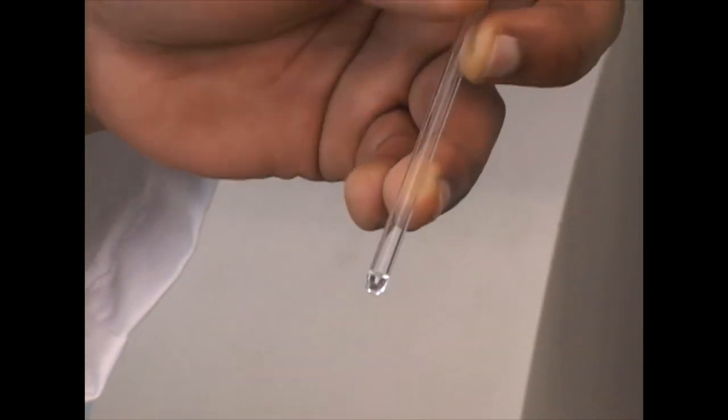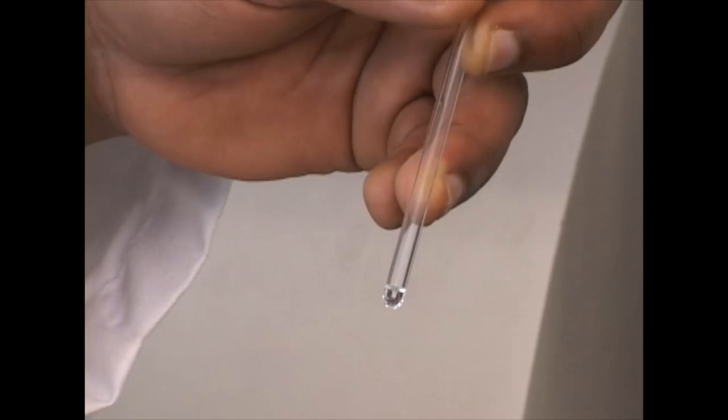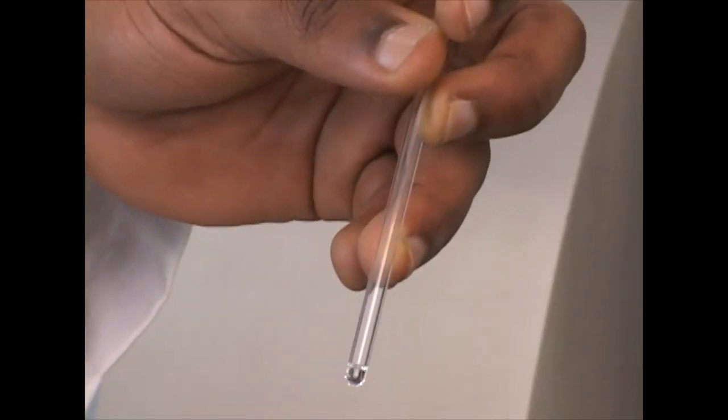The ESR can run liquid and solid samples. What we have here is a liquid sample which we can run in our ESR machine.